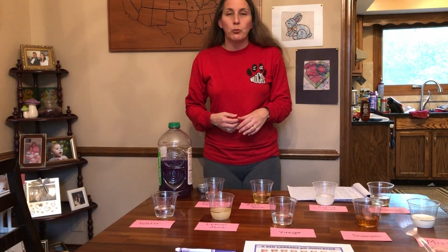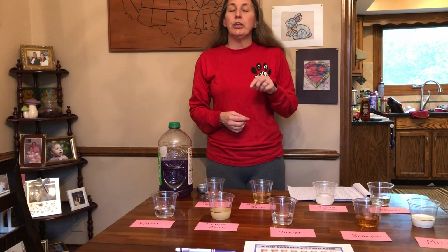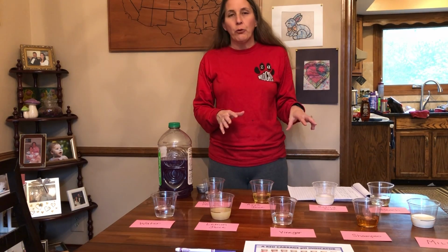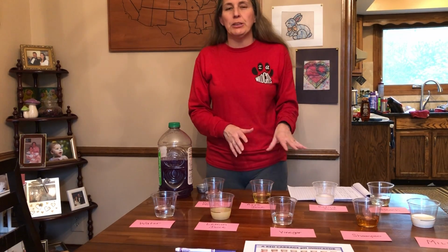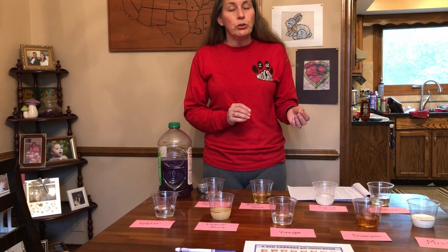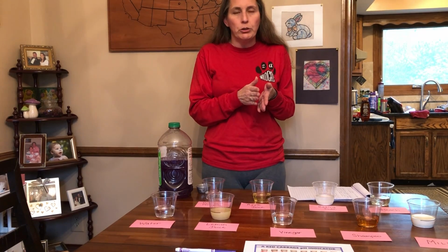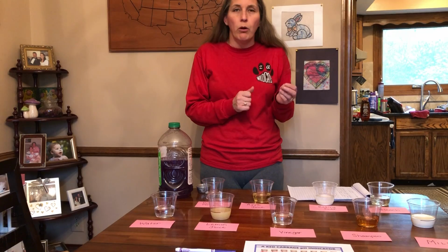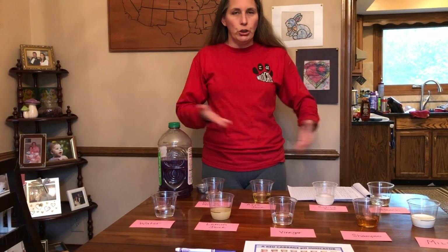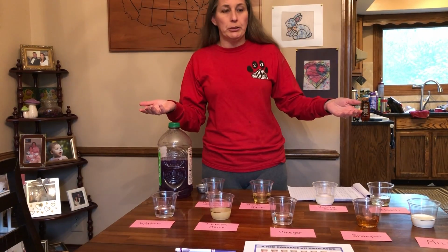So an indicator is one of the things you're going to read about. An indicator is just a chemical that causes a change in color based on pH. It does not affect pH. It does not interact with anything that's in that substance. It's just going to color change to show pH. Now, a lot of the ones used in chemistry are actually very specific and they work in a very narrow range. So you can only use them between like pH 2, 3, and 4 or 7, 8, and 9. But this one is called universal. Universal meaning it can show you all the different pHs. So that's why it's so great and it's super easy, although it makes your kitchen a little bit smelly.